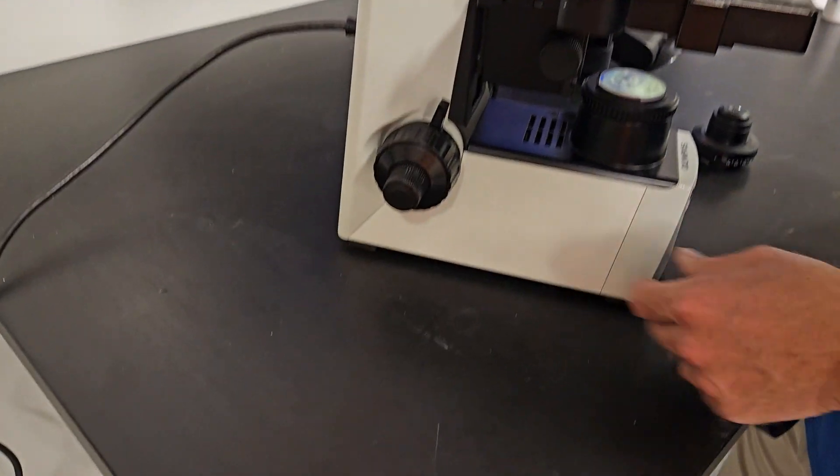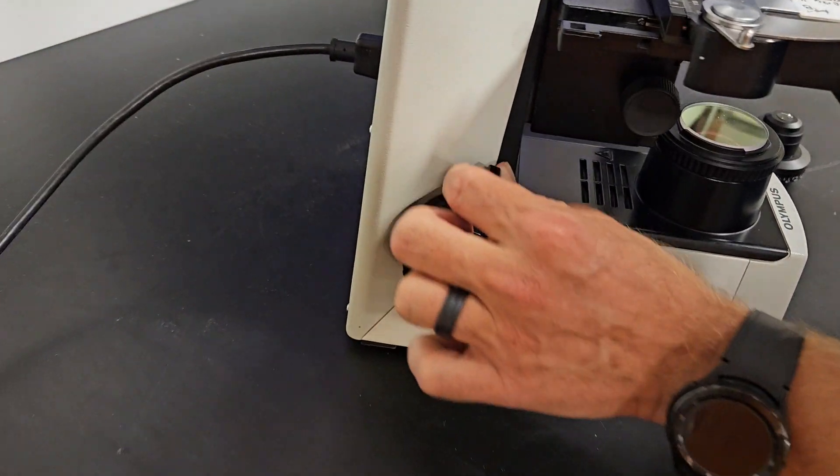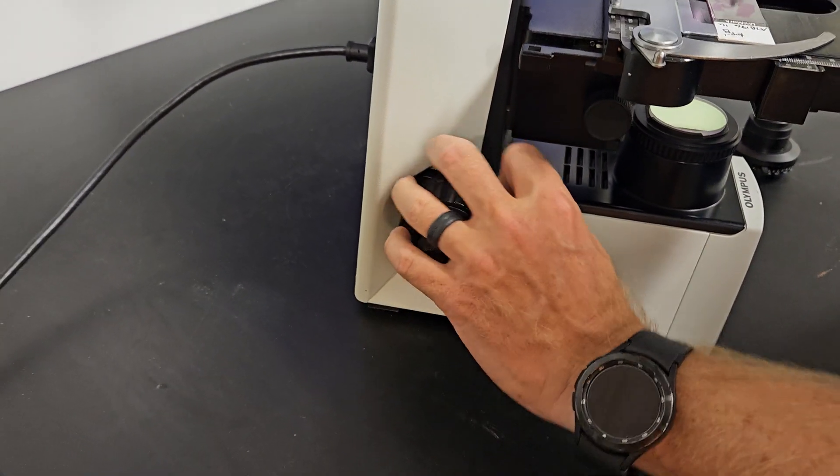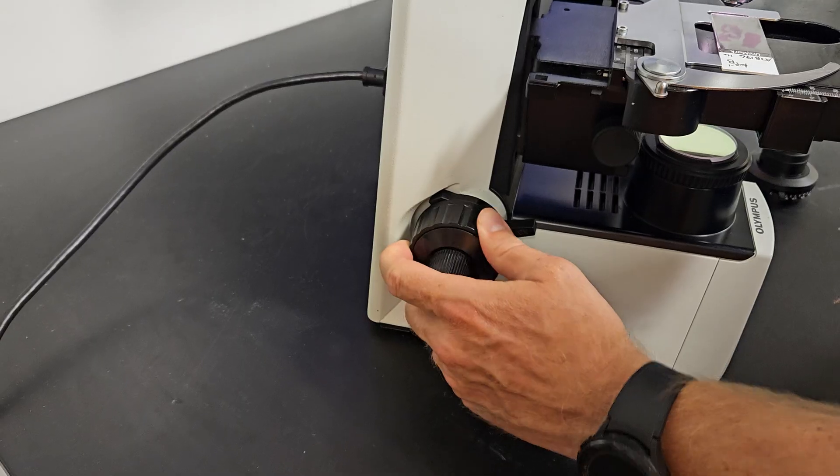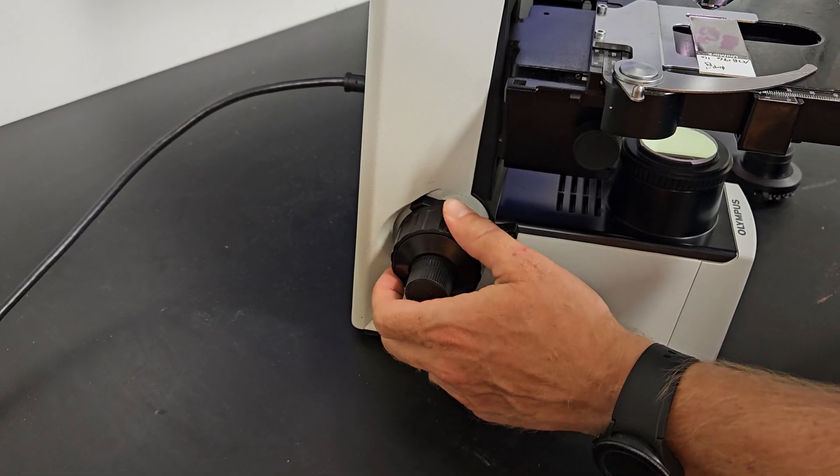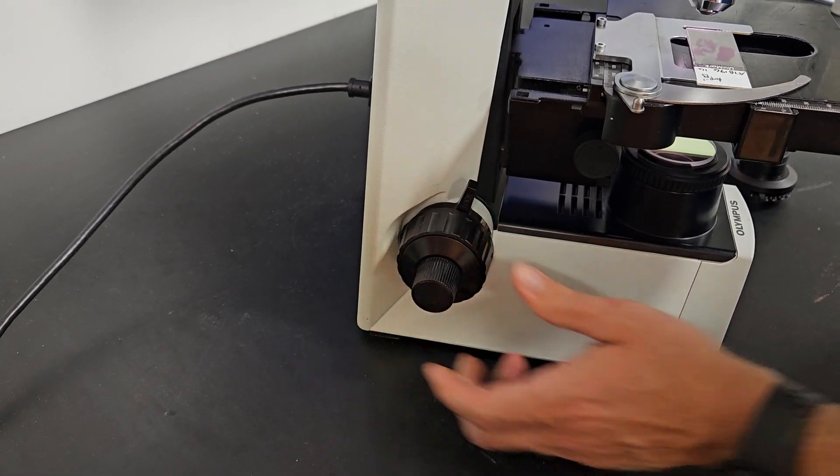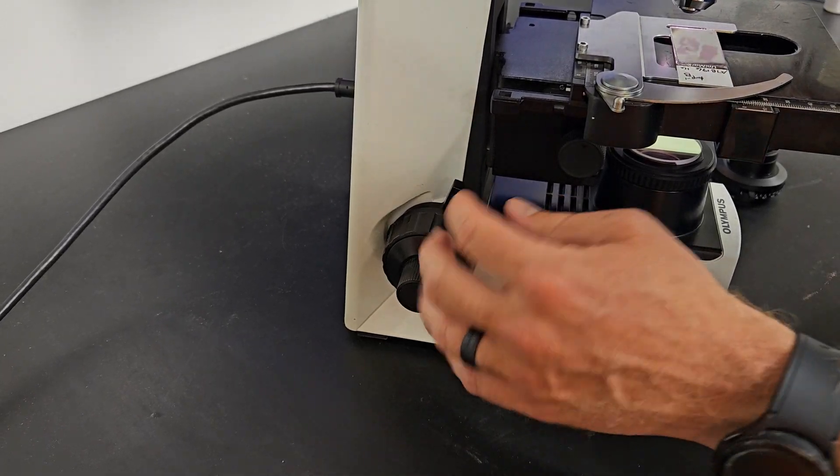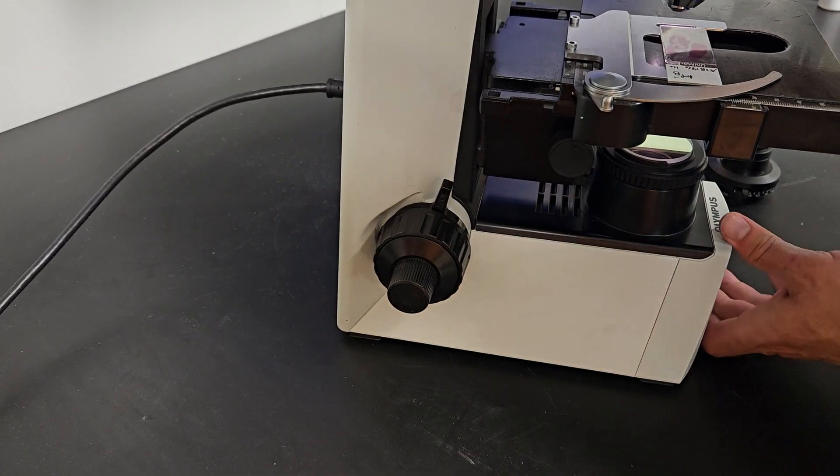A couple little housekeeping things. This is the brake. You can set the brake so you can only go so high. See how we can't go past that point and you can hear the brake release. If you ever can't focus past a certain point, a lot of times that brake might be set.